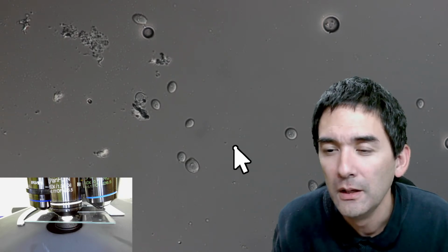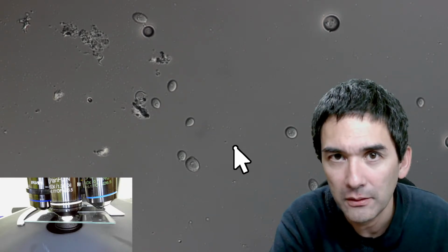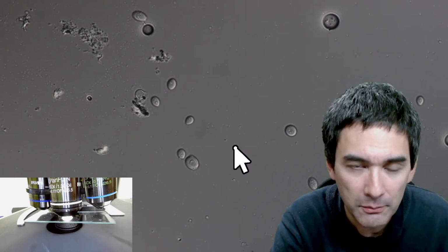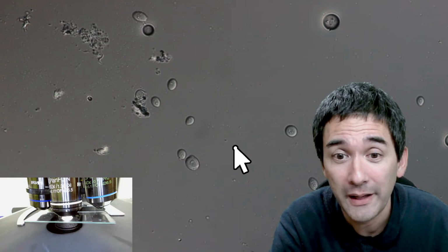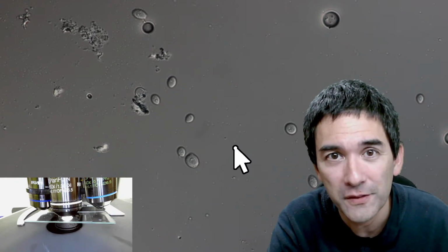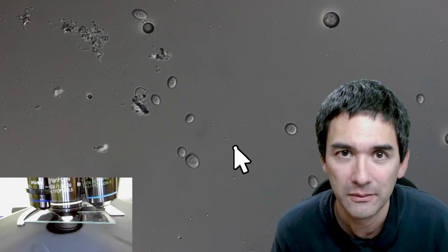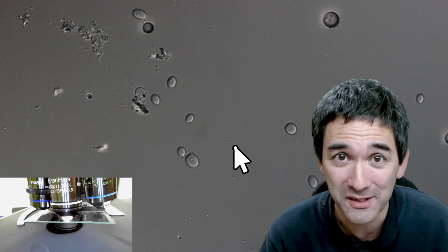Okay. What should be done if fungus appears on the objective lens? It basically means that you have a fungus growing on and in the objective. This can happen, and that's very unfortunate, especially if your microscope is in a very humid environment, in the tropics, for example. This is a known problem, and the problem is so big that some companies make objectives that are coated with an antifungal chemical to prevent the growth of fungi. I've had fungi growing on very old objectives of old cameras even.